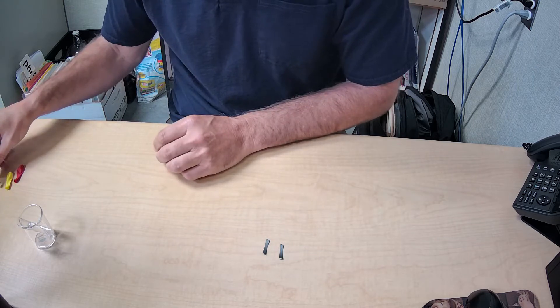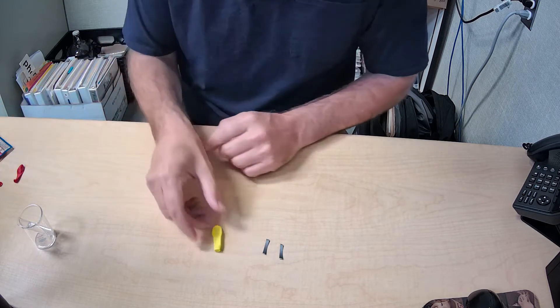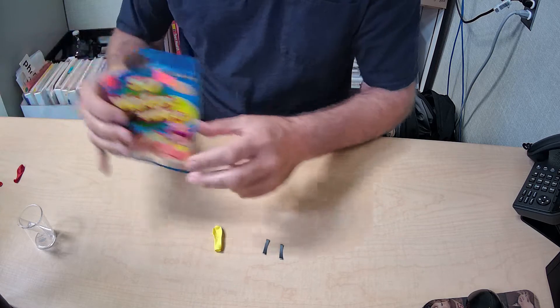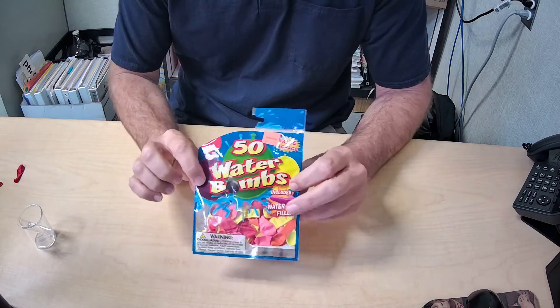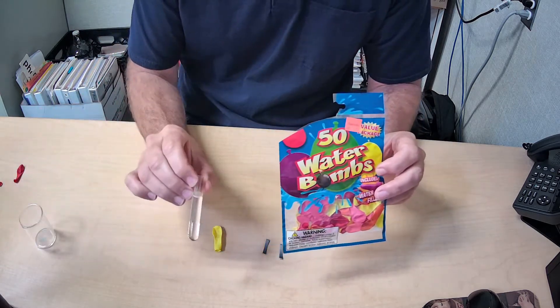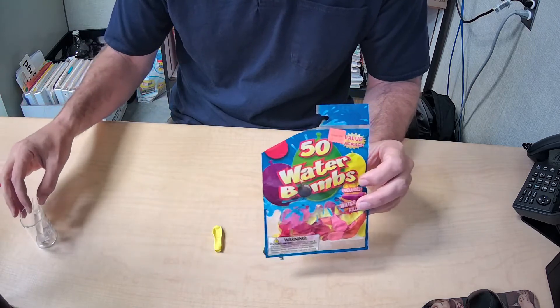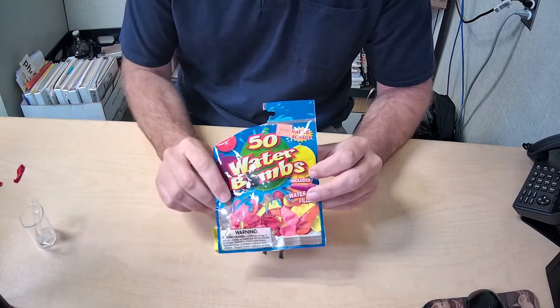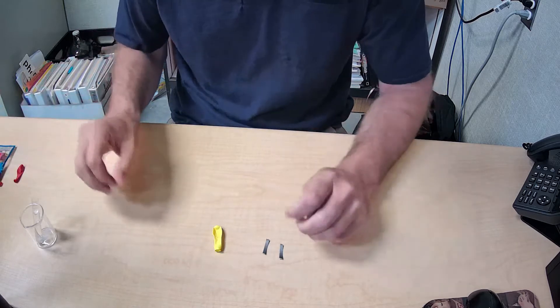And the only other thing that I need is a balloon. So I've got little water balloons. They work perfectly for this because they fit on this little test tube that I have. So I'm going to use a water balloon to collect the hydrogen gas.